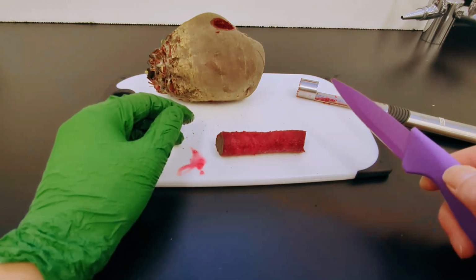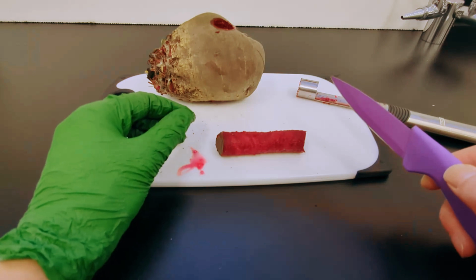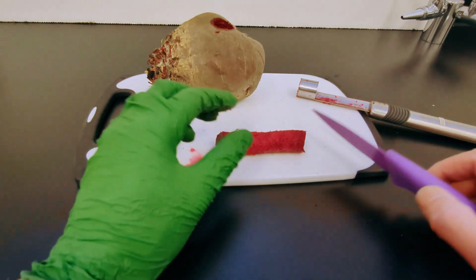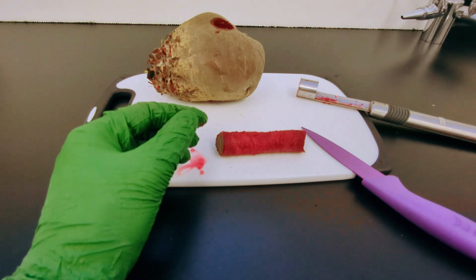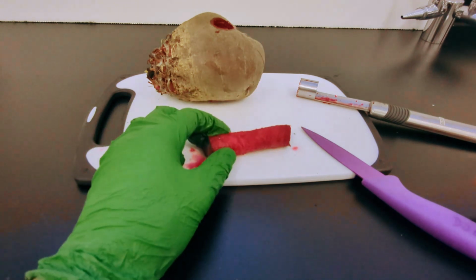Remember, in an experiment, we need to standardize everything that is not the independent variable. This way, we can be sure any changes observed in the dependent variable are actually caused by changes in the independent variable, nothing else. For example, we want to make sure in our experiment, the color difference that we observe in the end is caused by the exposure to different temperature and not the size of the discs.